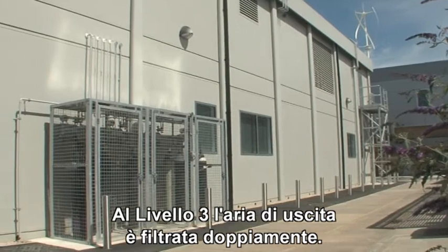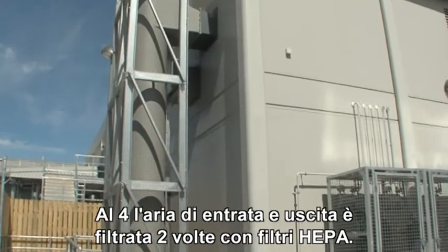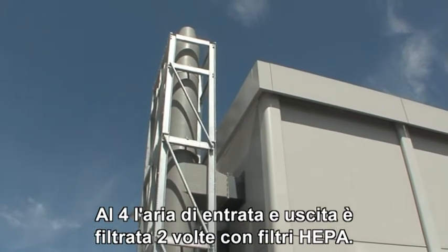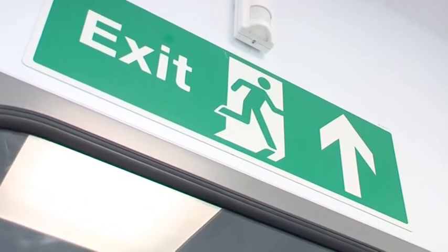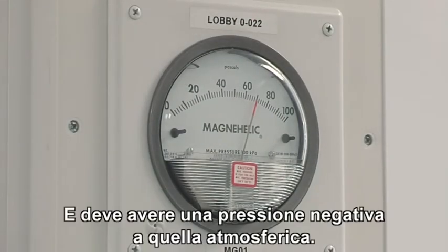At level 3, with extra precautions, exhaust air is double filtered. At level 4, input air and extract air is twice HEPA filtered. The workplace must be sealable to permit disinfection and be maintained at an air pressure negative to atmosphere.